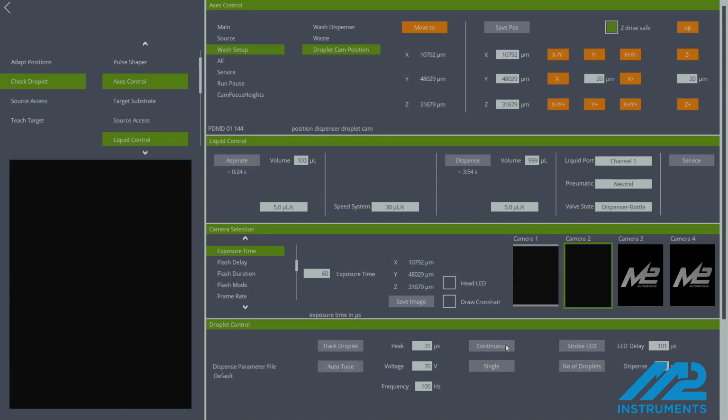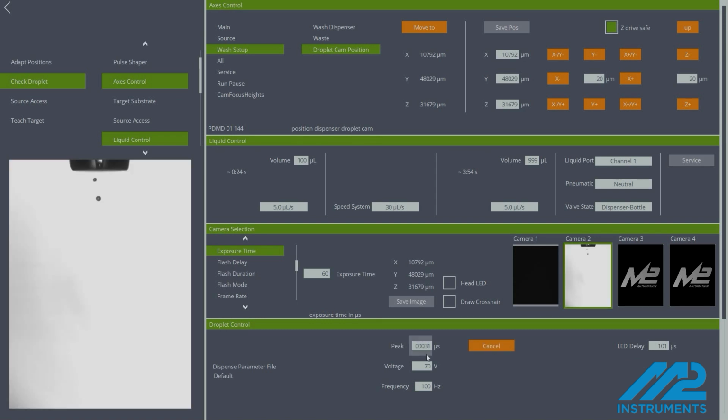In this video, a piezo-driven microdispenser, also known as a PDMD, is used. To dispense with a PDMD, the following dispensing parameters must be set: voltage, peak value, and frequency. It's important to note that peak value and voltage have a greater impact on droplet formation than frequency.